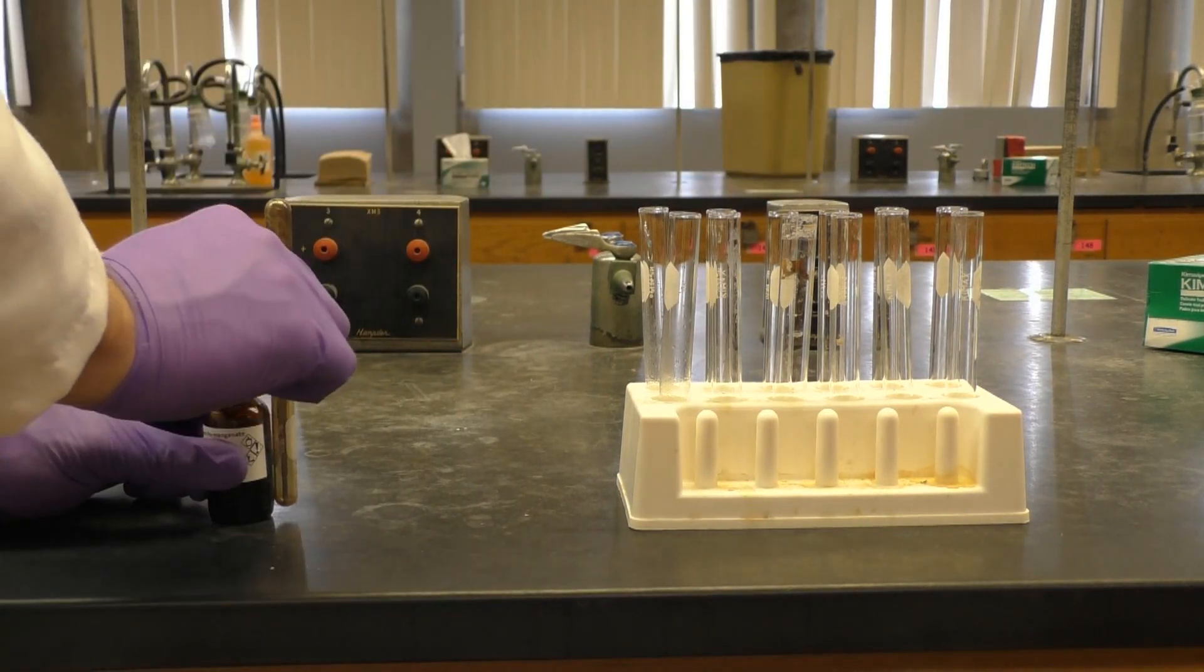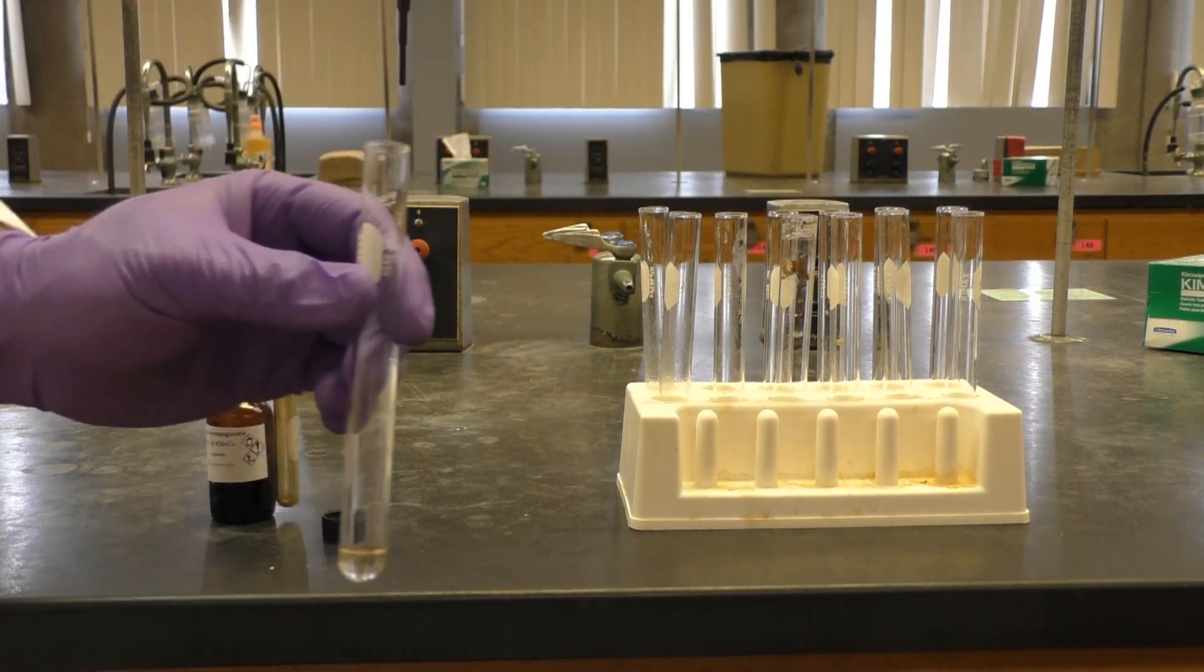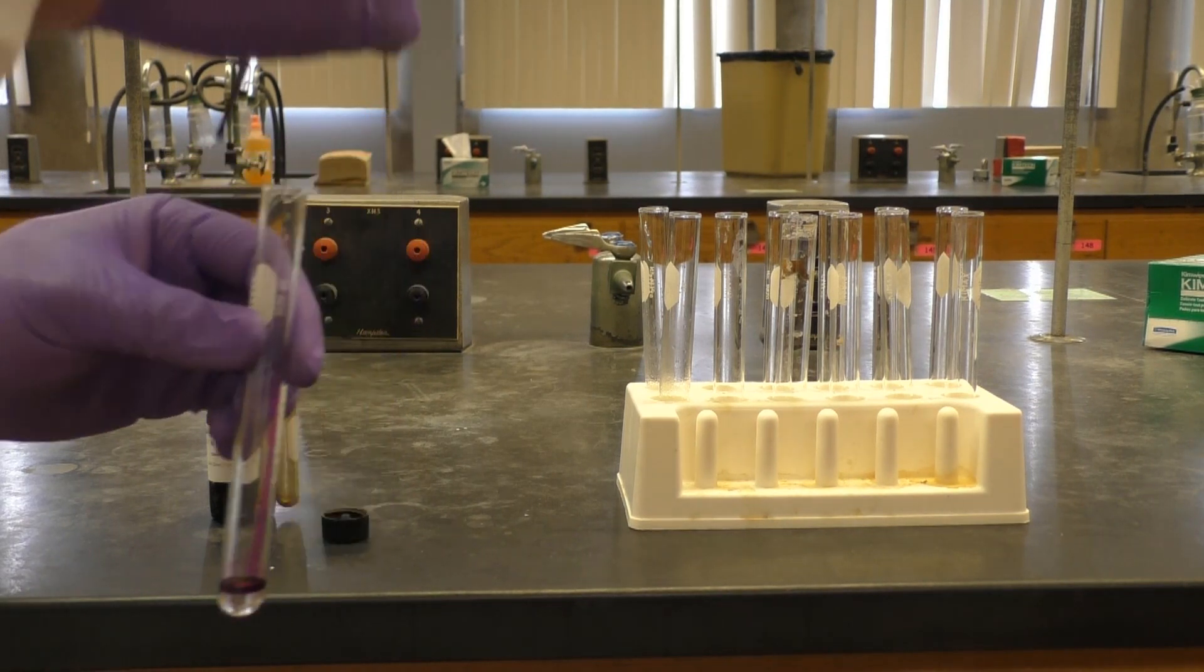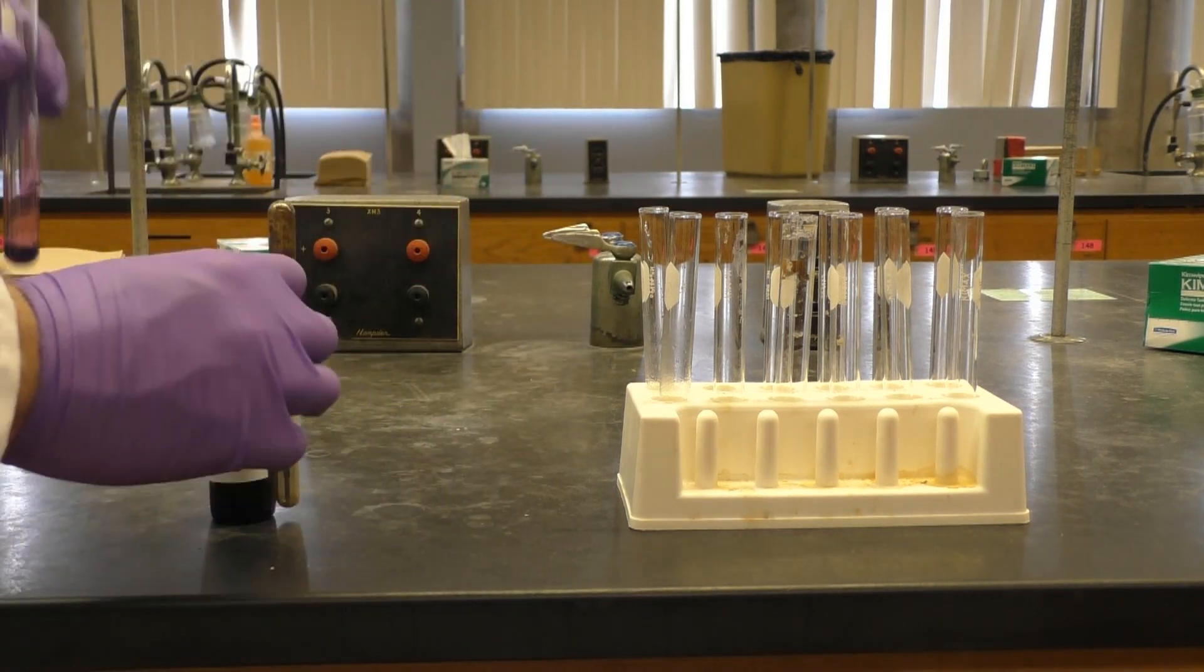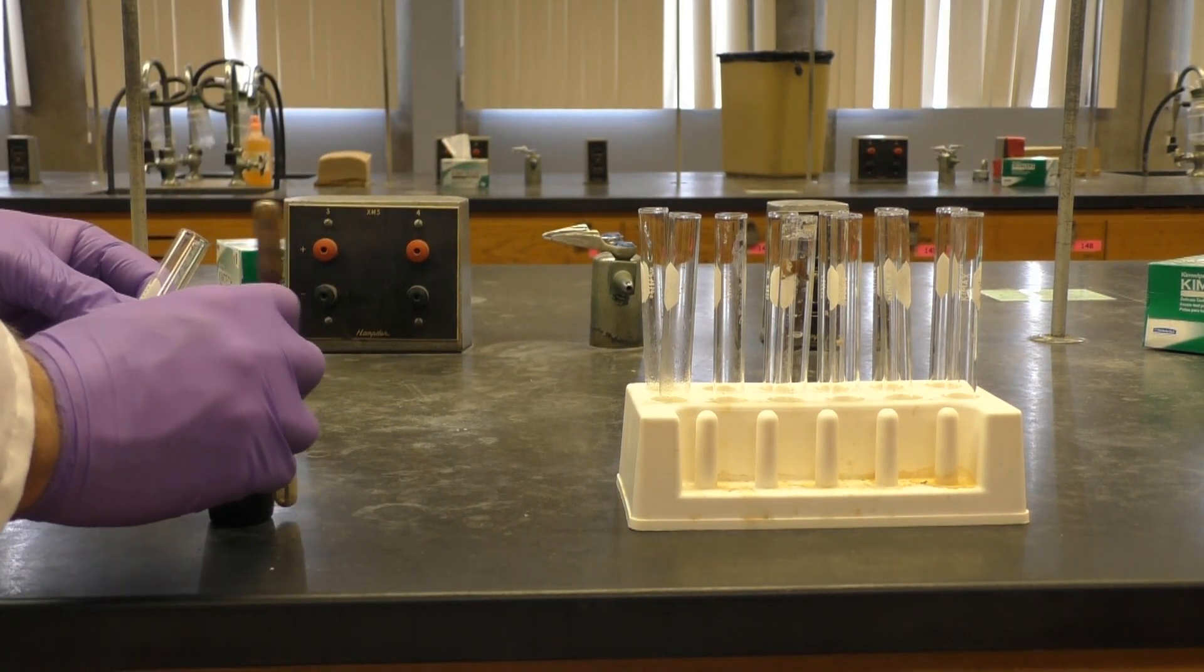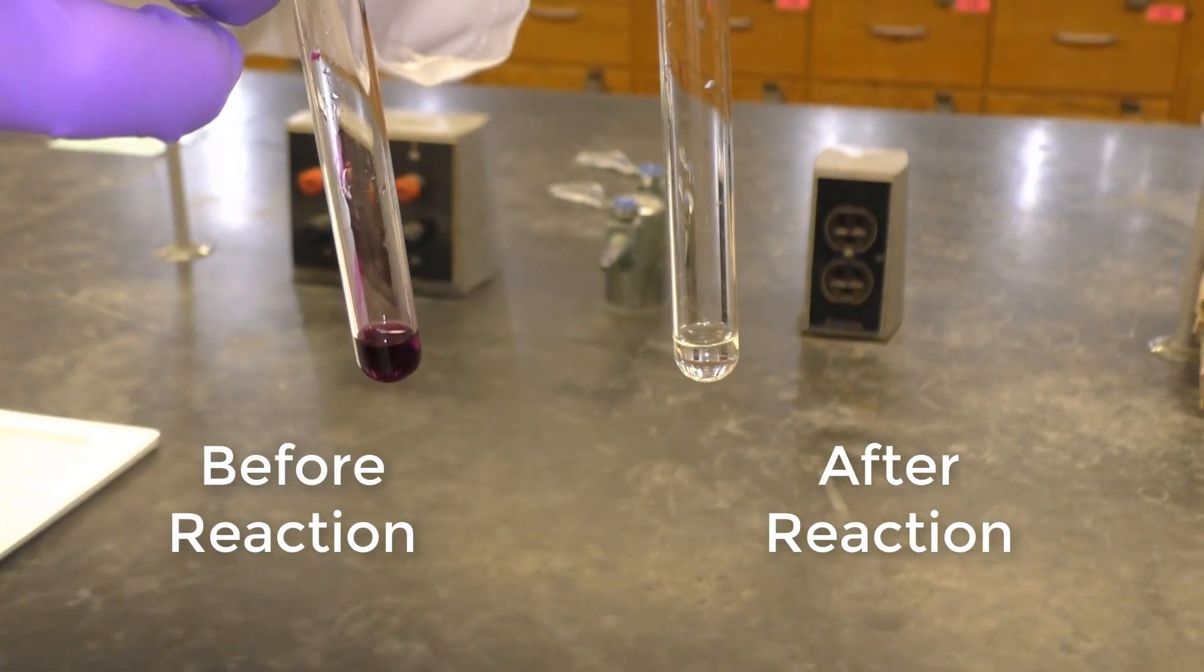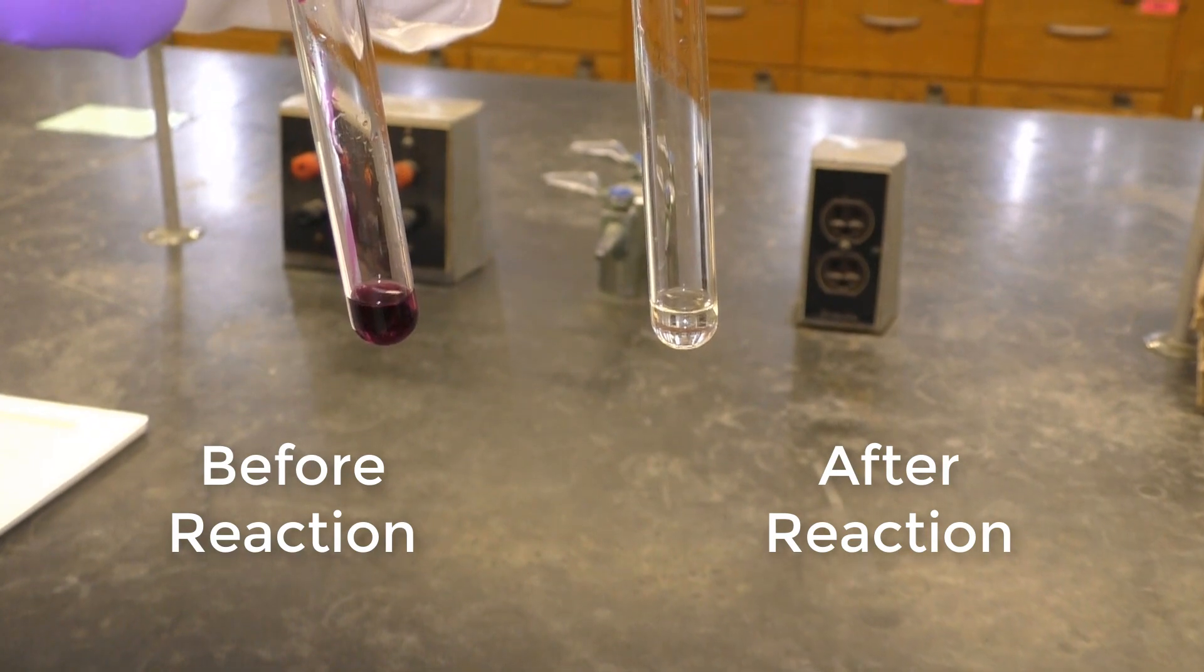If you refer to table 5.1, you'll see that potassium permanganate is a maroon solution. As you'll see, while we add it, the mixture becomes purple. But over time with mixing, the manganese 2 chloride is colorless or faint pink. In this redox reaction, the manganese accepted electrons and changed oxidation state from plus seven to plus two, resulting in a colorless or light pink solution.